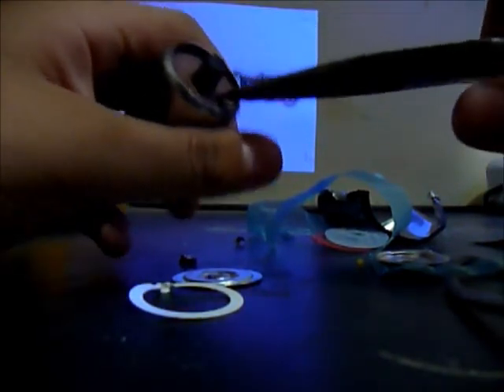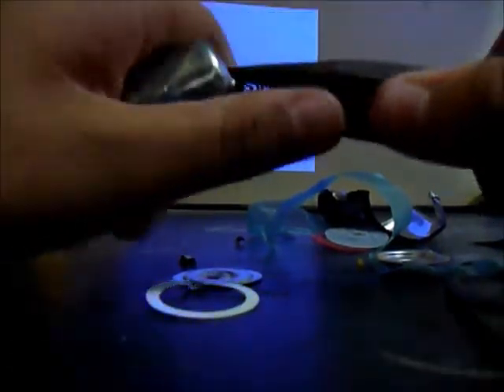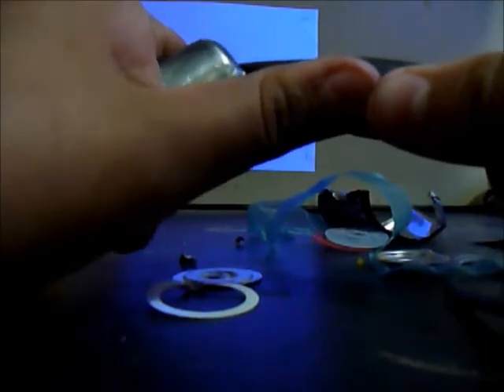Oh, it's hard. And, or you could just bend the metal, but just try to take it off. So I'll be showing you, oh, it's coming off.